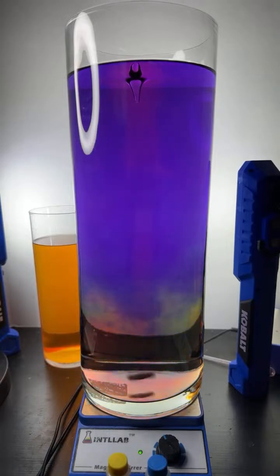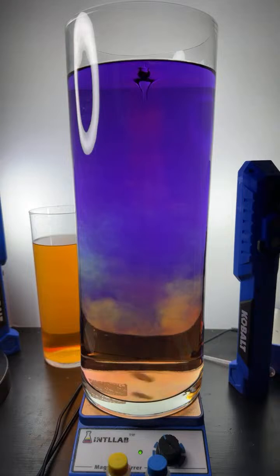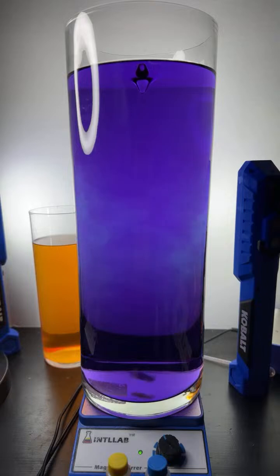Guys ready to see another experiment? You guys want to do another experiment? You want to do the color separation experiment? I've got that ready to go for you if you want. Trey's saying yeah. Oh, just stepped on a cup. See if any other folks want to do the secondary experiment. Let's go ahead and do it. What the heck? I got one ready here. So let me get this ready for you.